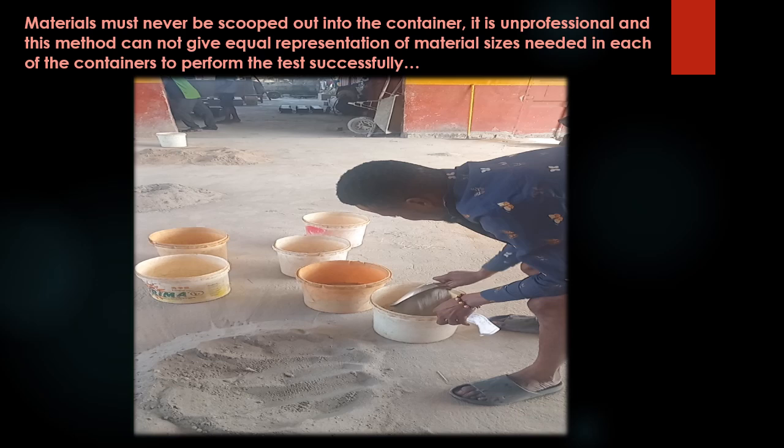Materials must never be scooped out of the container. It is unprofessional, and this method cannot give equal representation of material sizes needed in each of the containers to perform the test successfully.